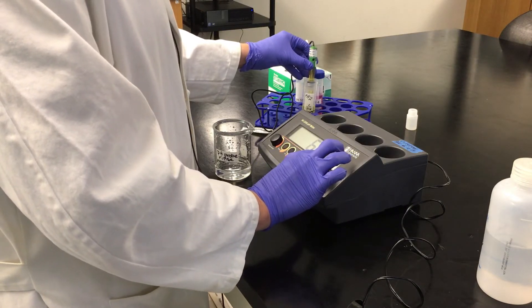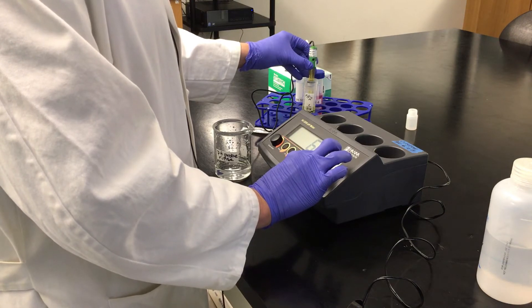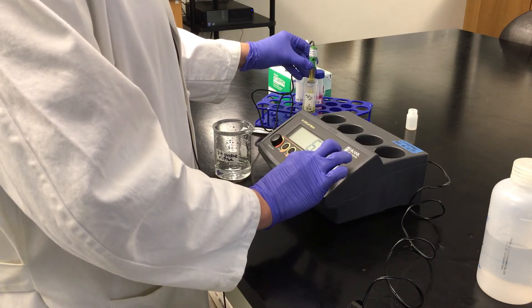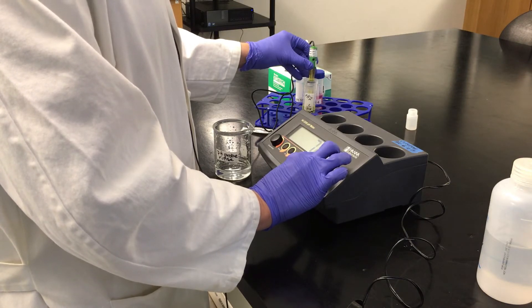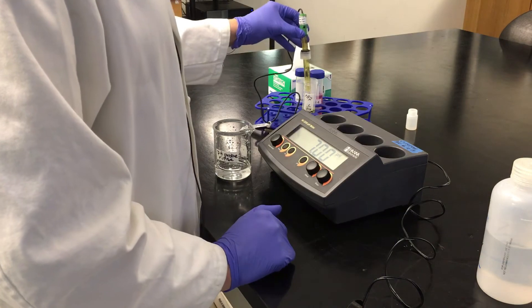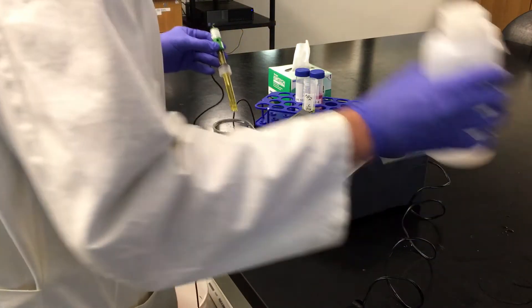It goes slowly. I'm going to remove it from the pH 7.